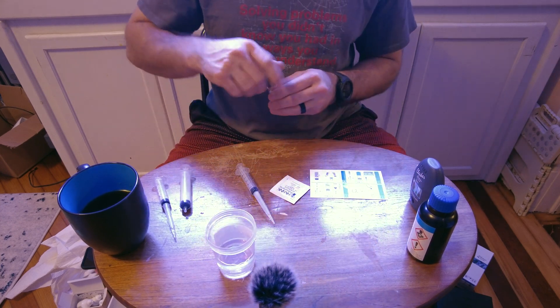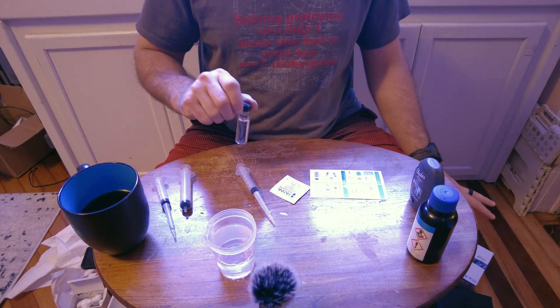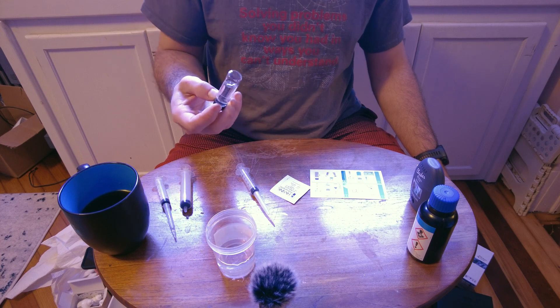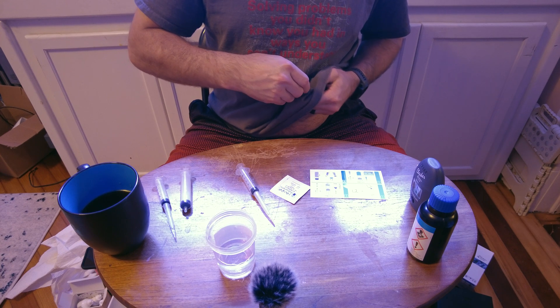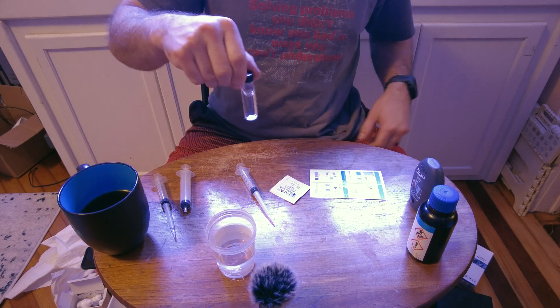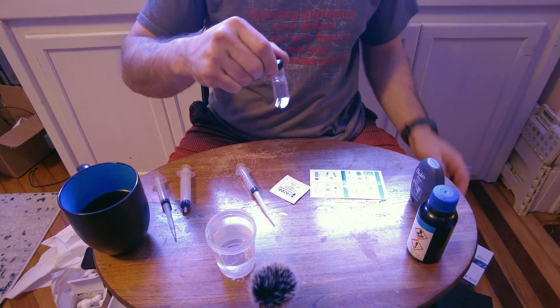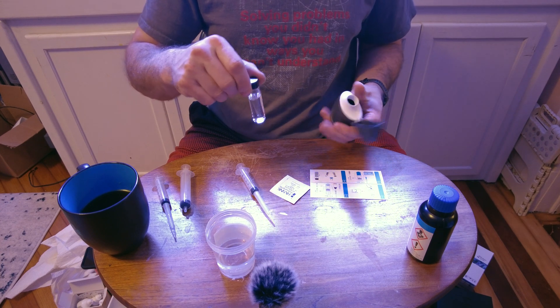Give it a light mix and invert it gently — there is a warning about not having bubbles. You're not shaking it, just swirling. If you've got bubbles, tap it or slowly invert to work them out. Bubbles affect the light transparency through the test. The way these Hanna Checkers work, they're a colorimeter — also called a photospectrometer — measuring at a fixed spectrum.